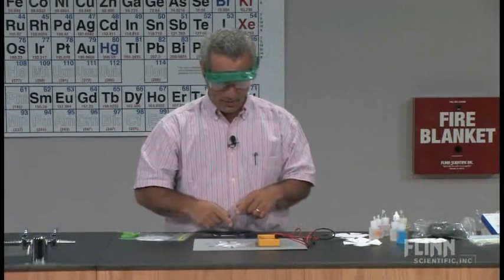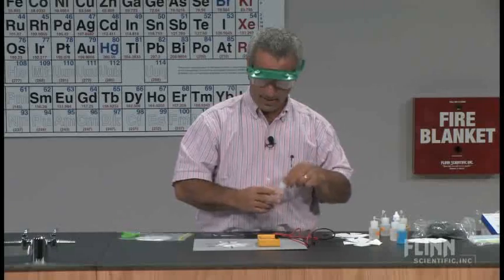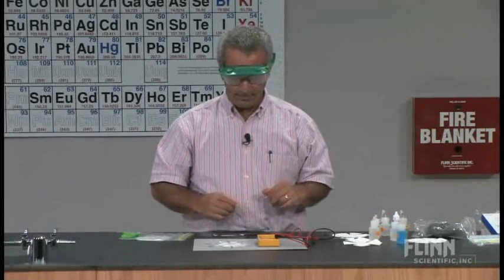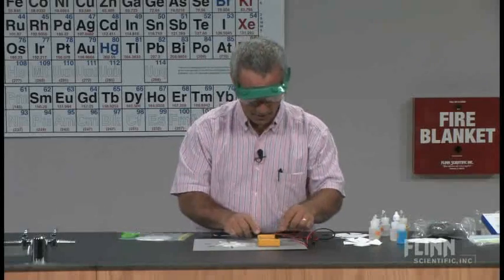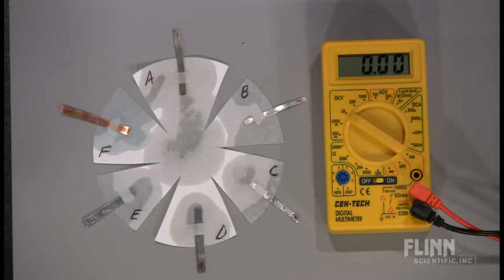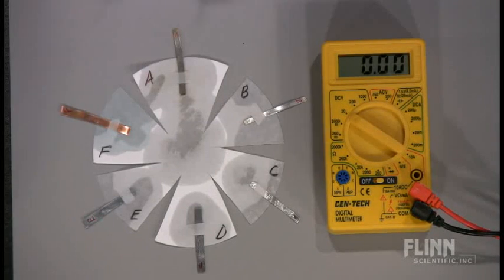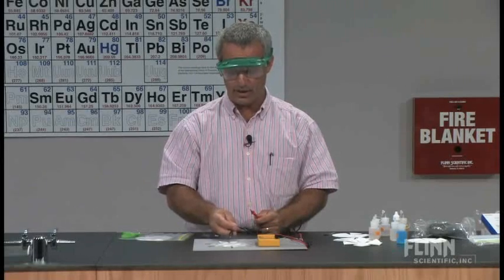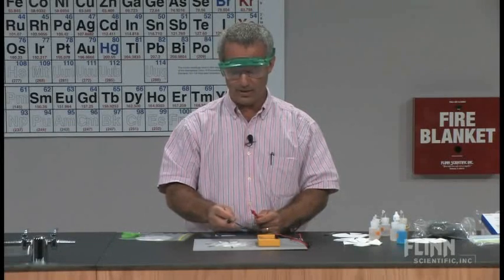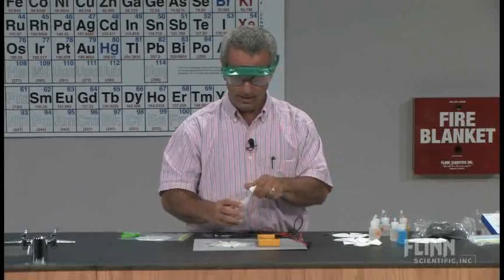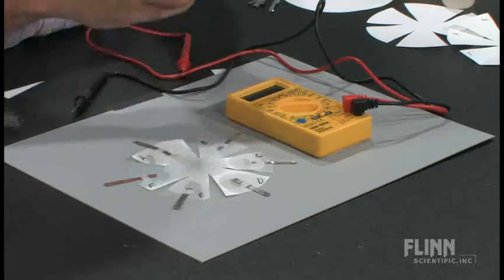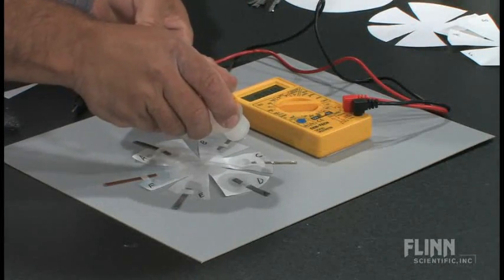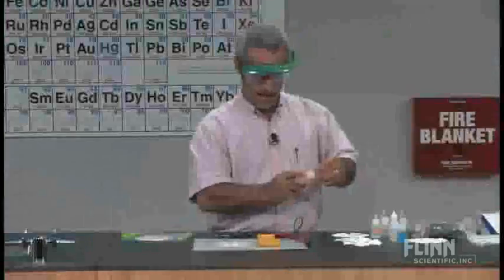Now they're still migrating a bit. I might put an extra drop or two if I see they're not going to get there quite. Maybe one more drop of B here. Now we're ready to go. I'm going to start by turning on the voltmeter. And then it's zero. What I'm doing is I'm essentially going to pit these metals, these solutions actually, up against each other, one against one. Let me have one more drop of D, just because I can see it's taking a little time to absorb. And maybe C. The rest look like they've all made contact.